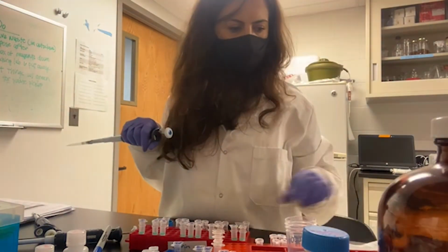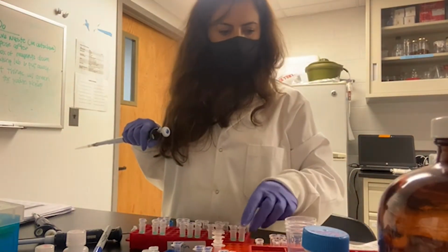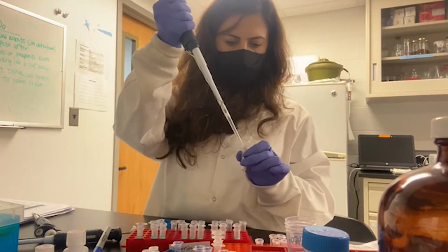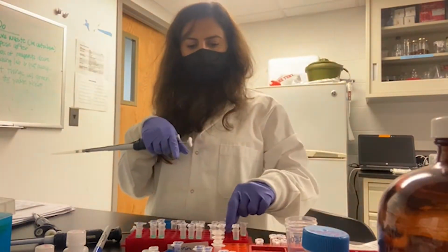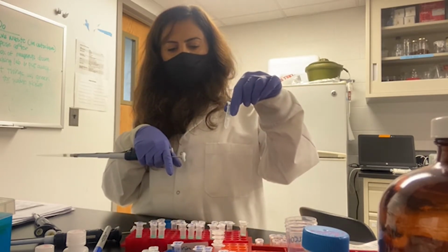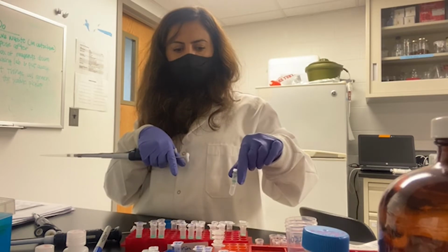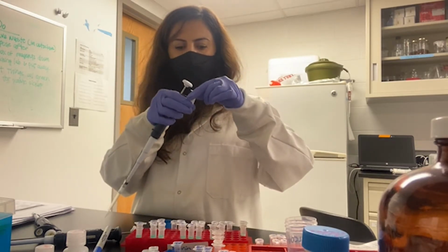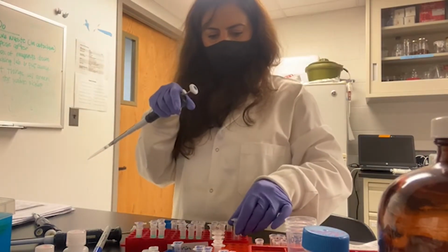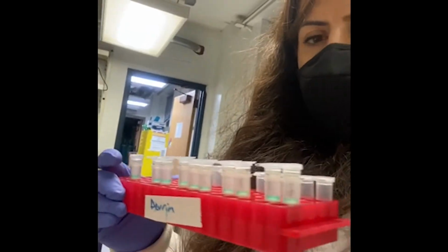I'm going to transfer all the mixture from this tube into the Zymo column collection tube, and then I will centrifuge it. I'm going to do the same thing, transferring all the samples in 2 rounds into my columns. First I centrifuge, and then discard the liquid here, and then add the rest of the lysis plus sample plus ethanol into the column. Now I transferred half of my samples into my columns, and the next step is to centrifuge.